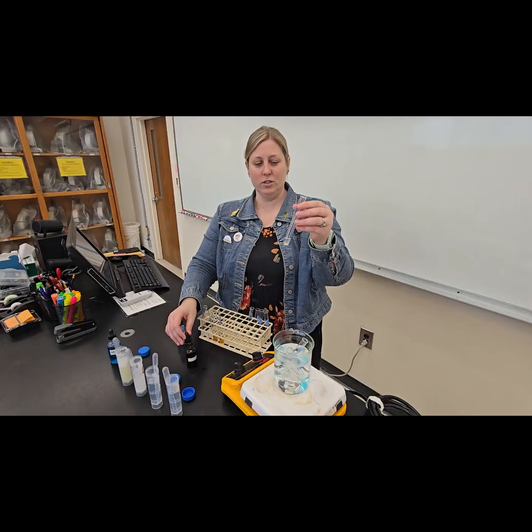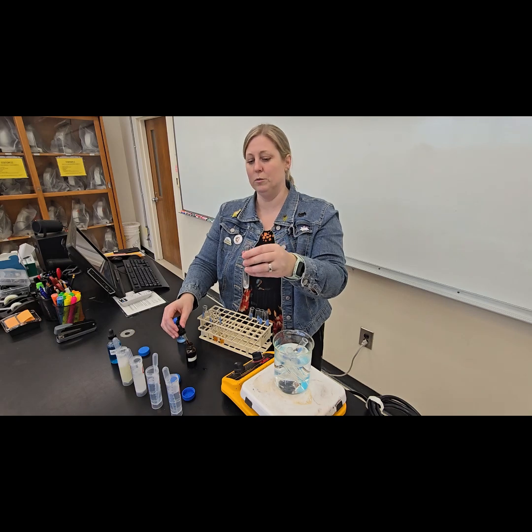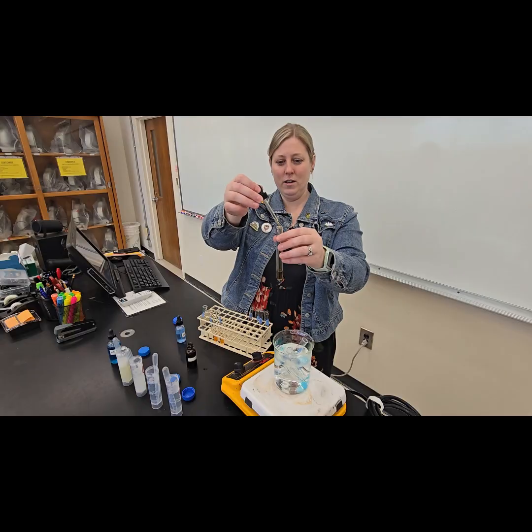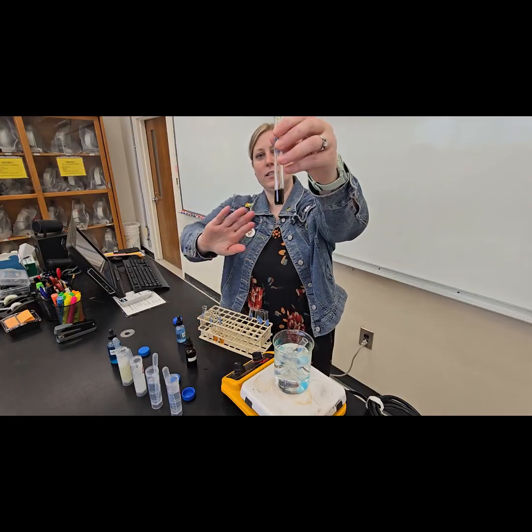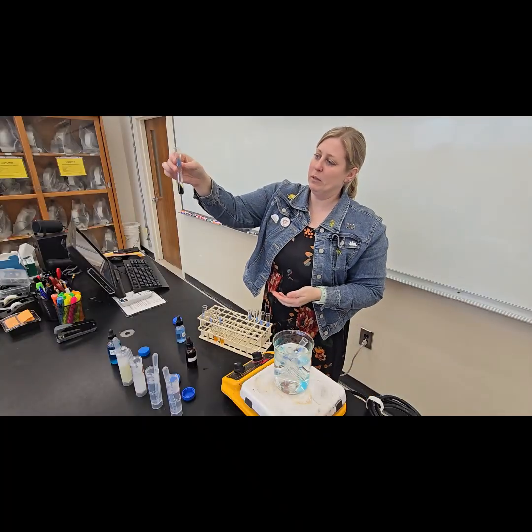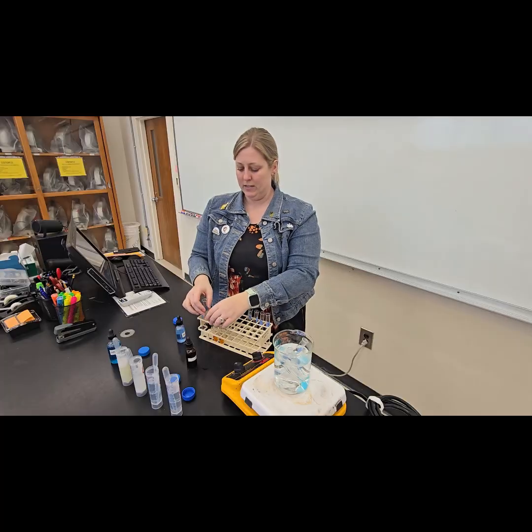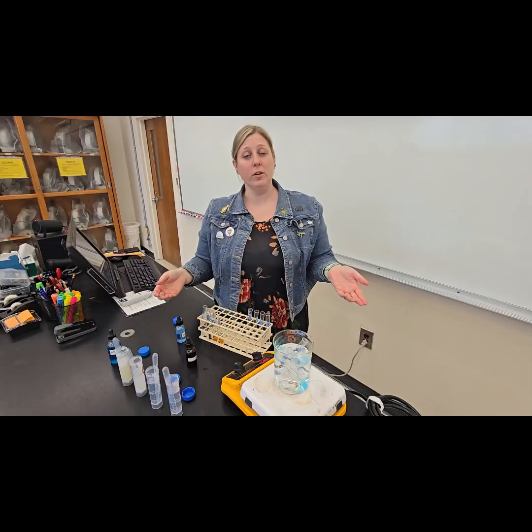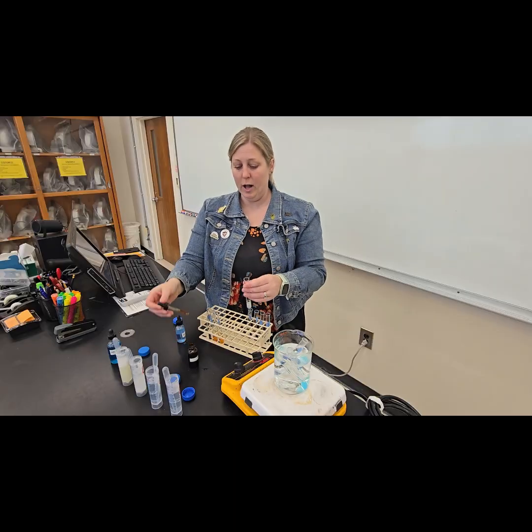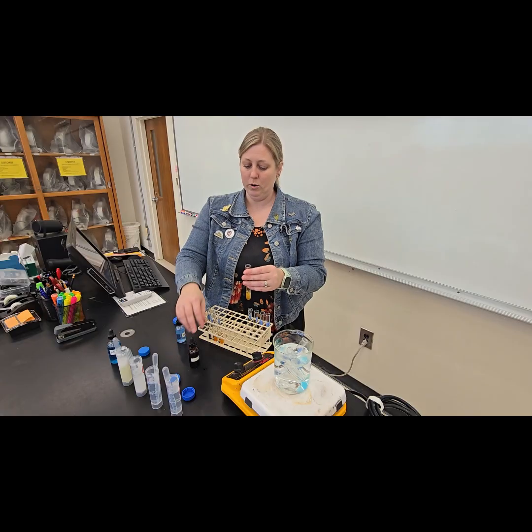However, we are testing a starch solution. If I don't see a strong result with this one, someone didn't make the starch solution properly. So let's go ahead and add some in there, and we should immediately see it turn a nice dark color. We get that kind of almost black coloration, and that tells us that there is absolutely starch present in this solution. So that's what we would be looking for in a positive starch test. And let's just make sure that our albumin doesn't react. It shouldn't, because albumin is a pure protein.